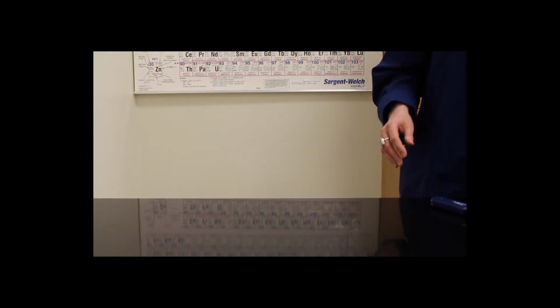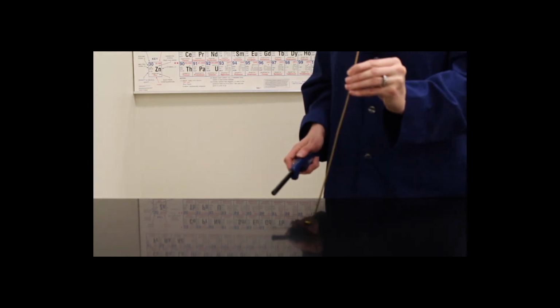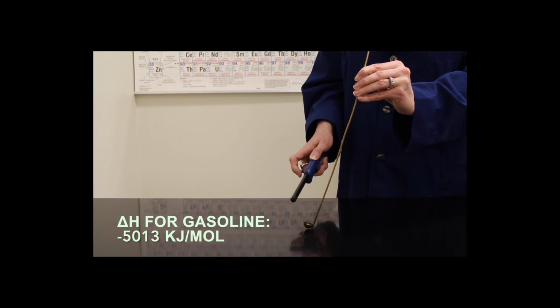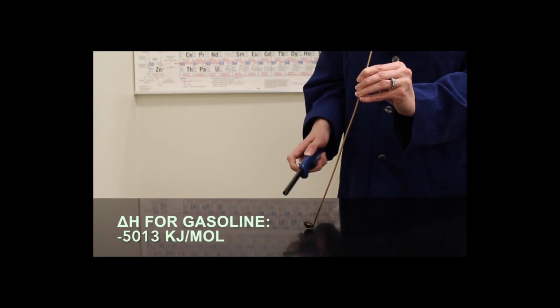The last substance we're going to burn is white gasoline. This is the largest molecule of the 4 substances and will have the largest heat of reaction.